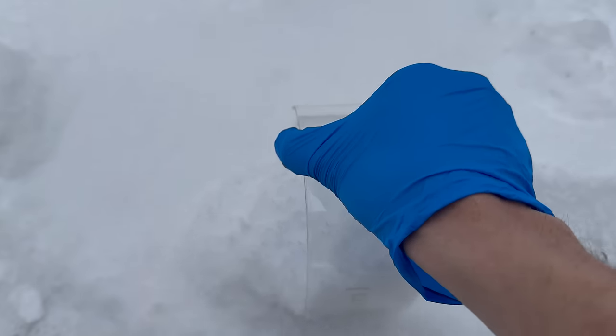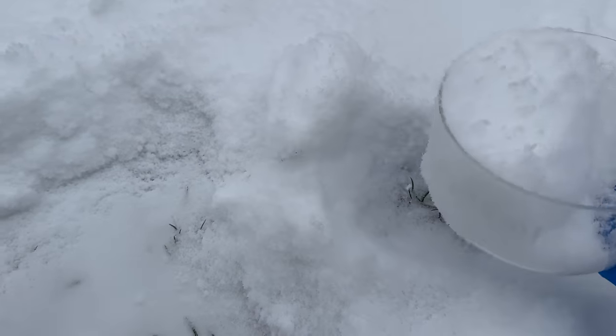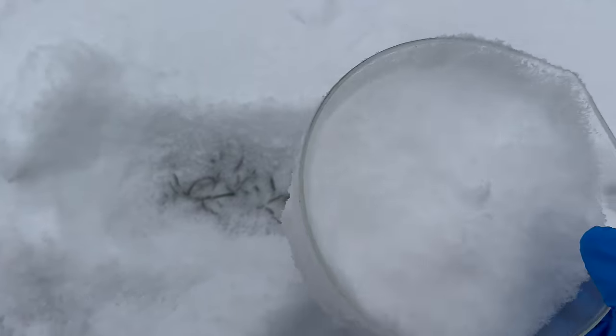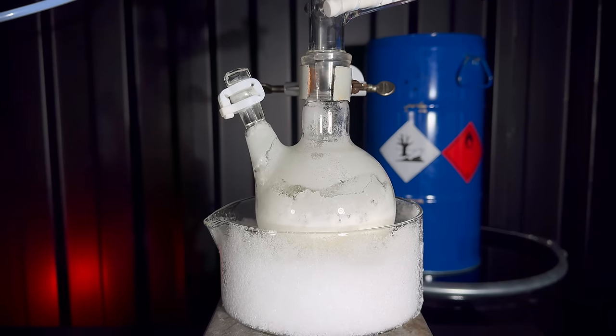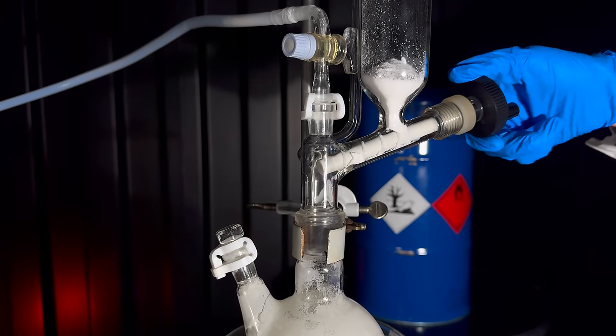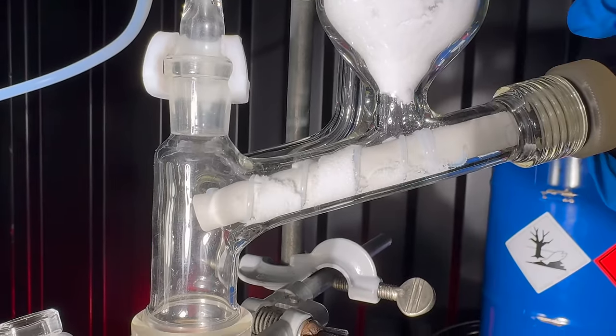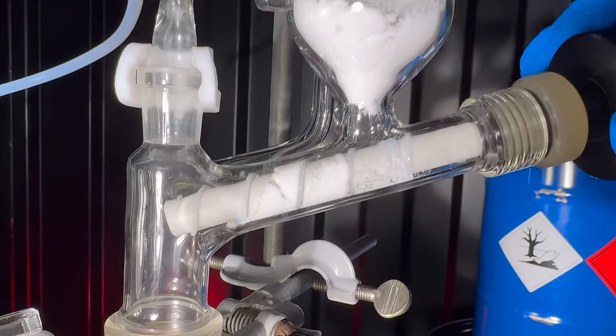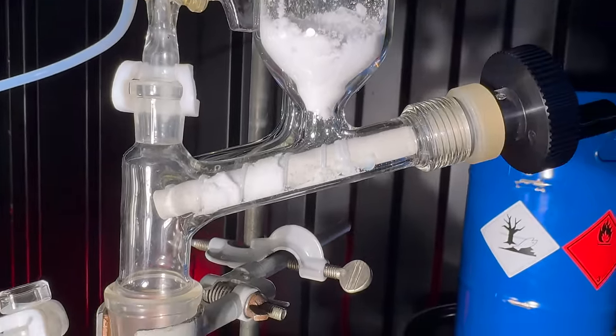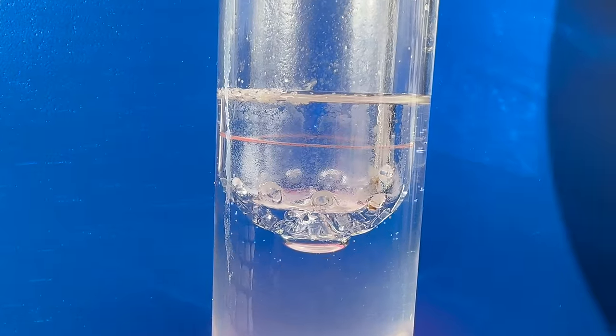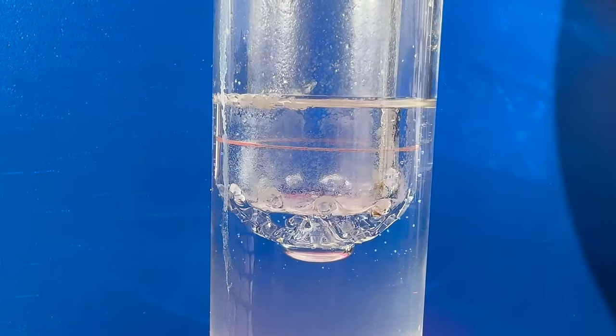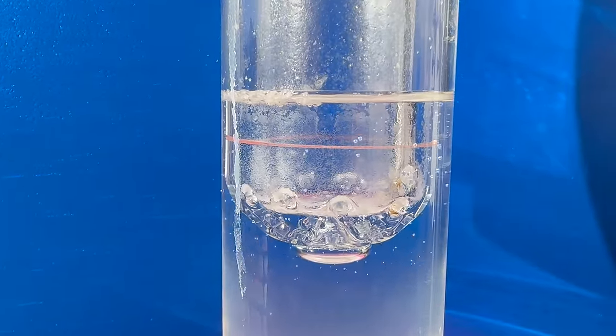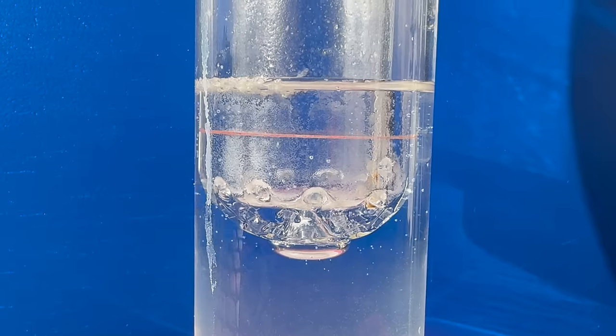As I've never tried this before, I decided to use some free cooling, because I didn't know if it would get hot. I set up the cooling bath and then slowly turned the knob to push in the oxalic acid. I gotta say, I am fascinated by this piece of equipment. So simple, yet so useful. The reaction is pretty harmless as it turns out. I wouldn't even have needed the powder addition funnel. Two days later, when it got warmer, I observed bubbling in the washing bottle.